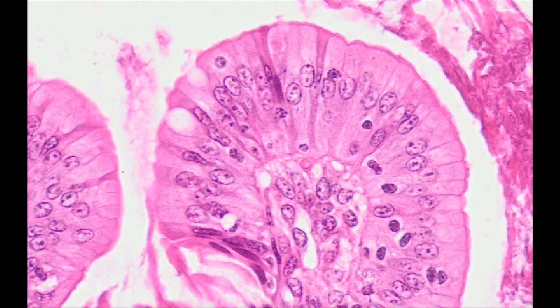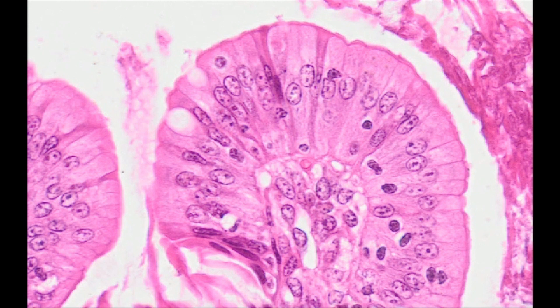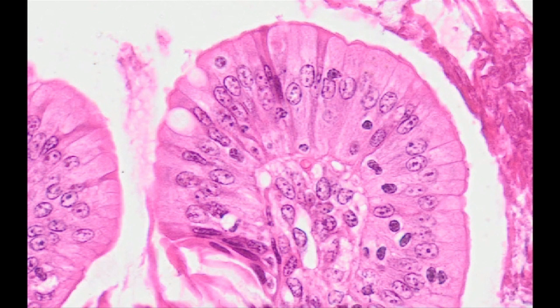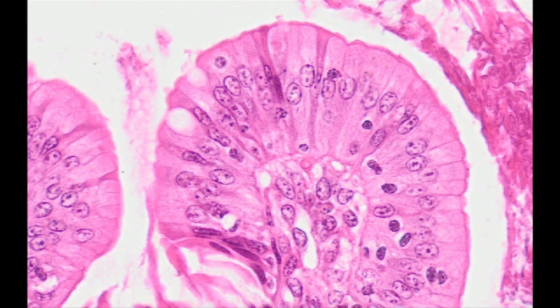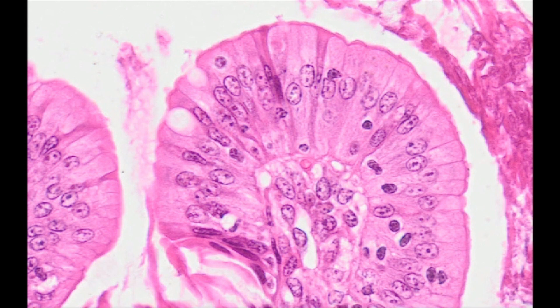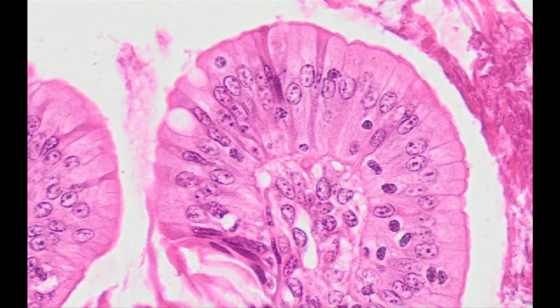These structures are tissue-specific and occur in epithelial tissue in the form of cytokeratin filaments. The tissue specificity of intermediate filaments is used in histopathology to identify tissue types and to determine their origin, for example in cancers. Specific antibodies are used to determine the subtypes of cytokeratin proteins and thus find out about the exact origin of cells — for example, whether they arise from the intestinal epithelium or the epidermis.